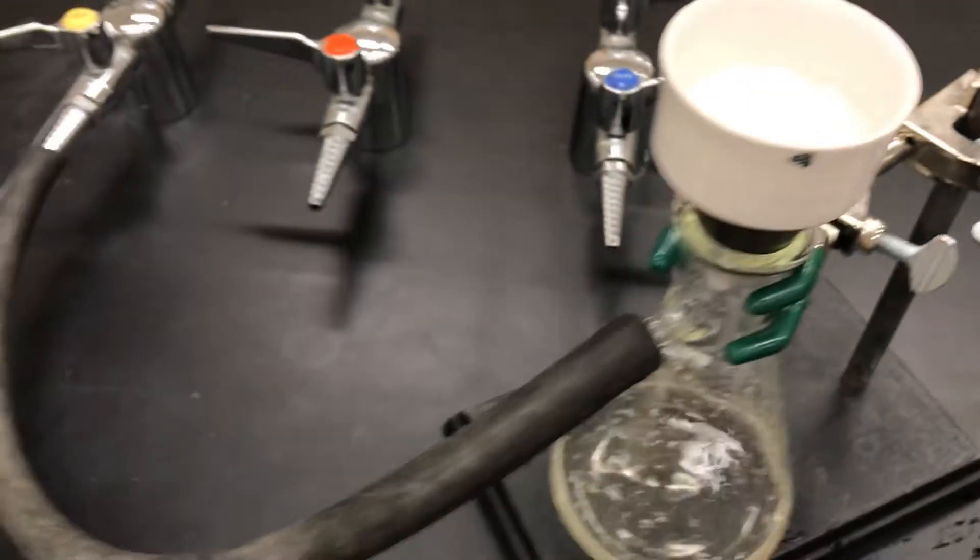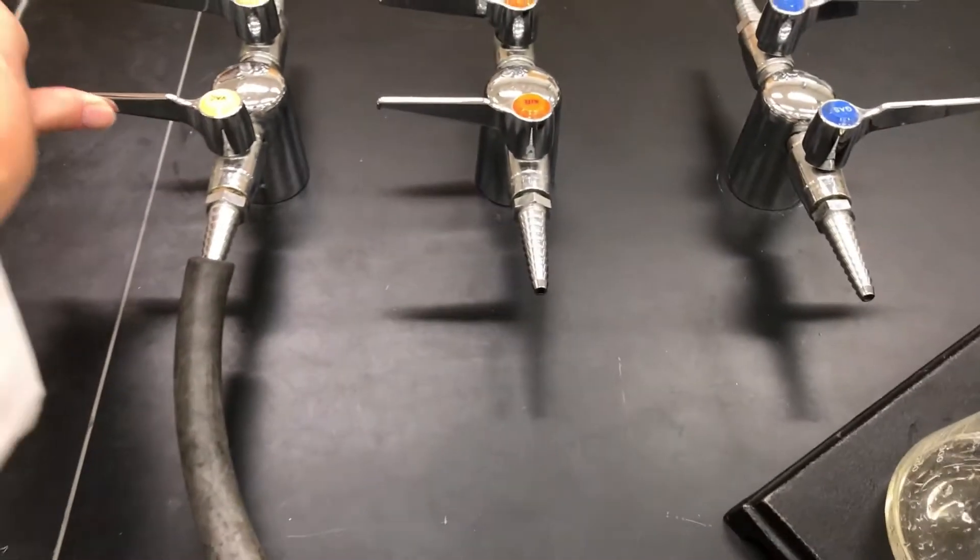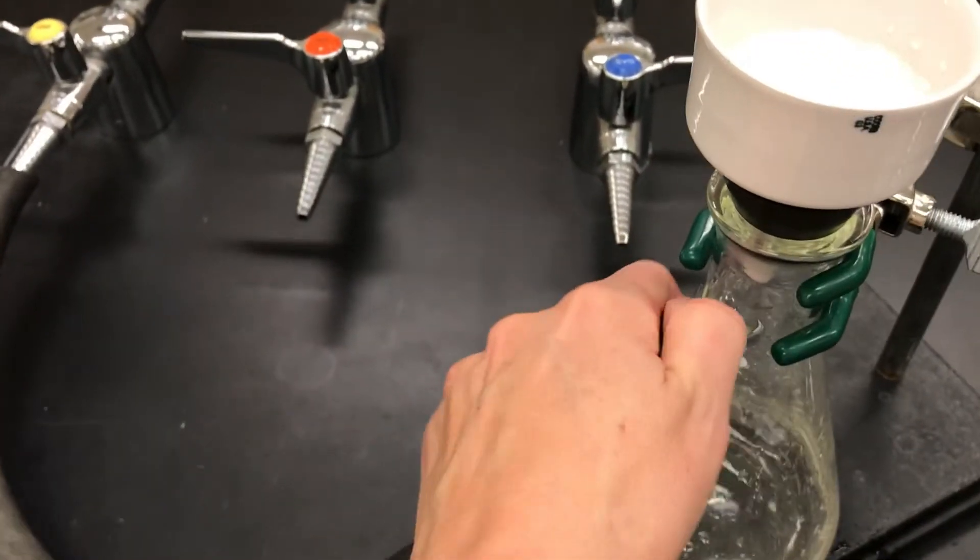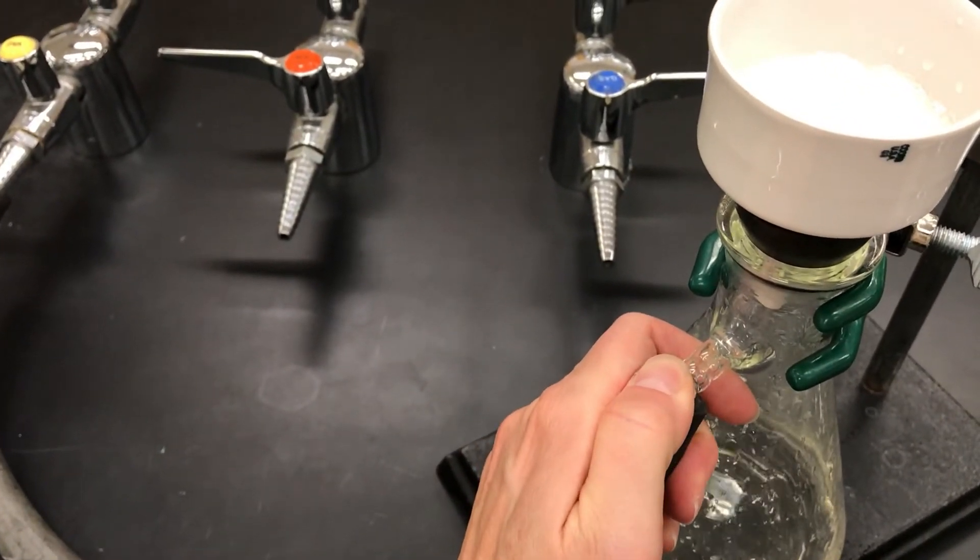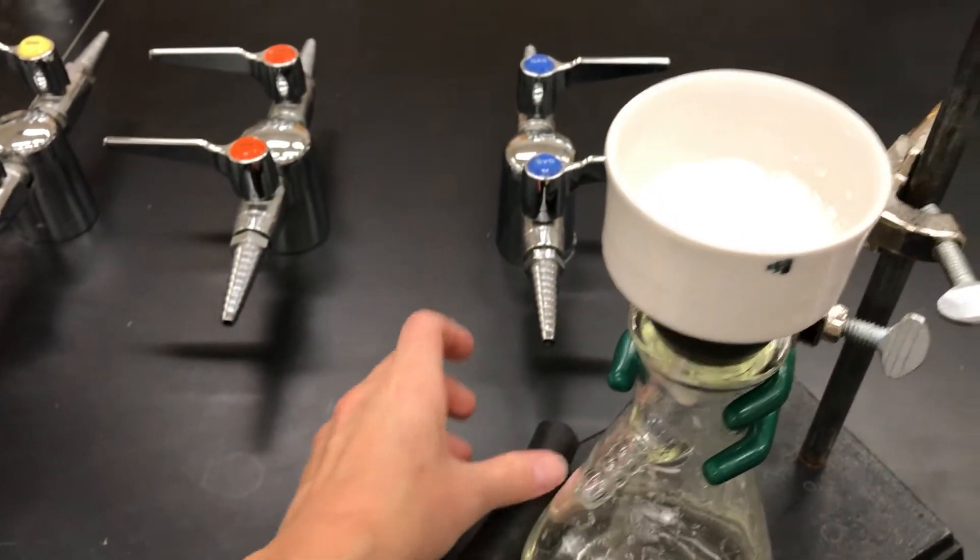When the filtration is done, then you can turn off the vacuum, take off the hose, and then collect your solid.